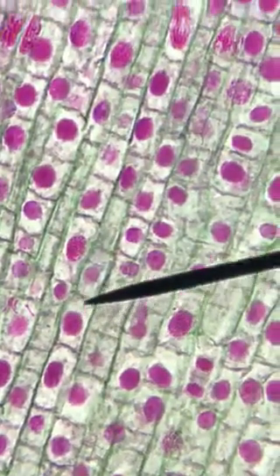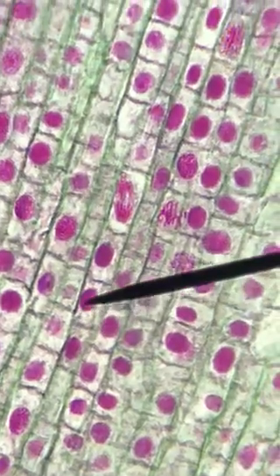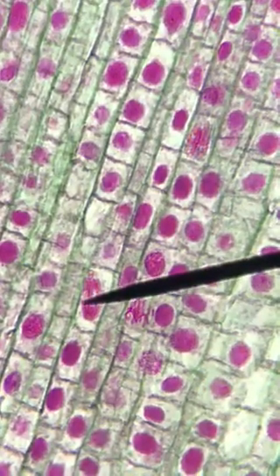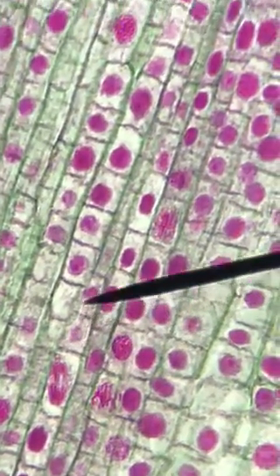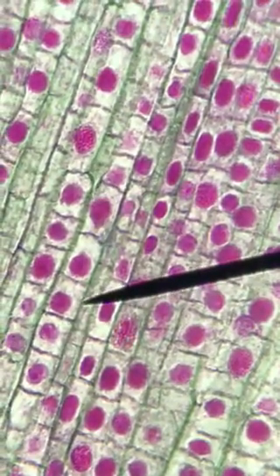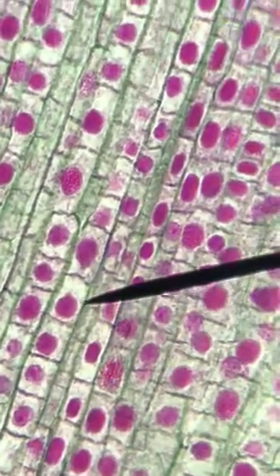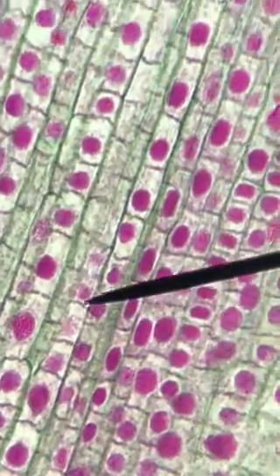We continue to move along. This is oriented really well for this. Continue chugging along. And then we get to a point where, wow, look at that. We've got anaphase right here. This is a great example of anaphase. So we're going to continue moving along, move it over maybe a little bit. Right here I might just jump over. For the sake of data, I'm going to jump over because it looks like there's not too much going on in that column.